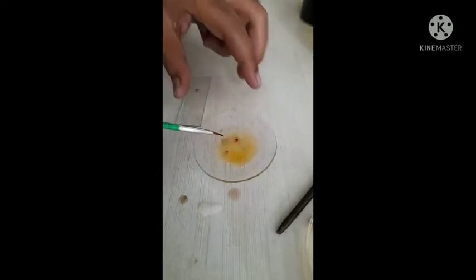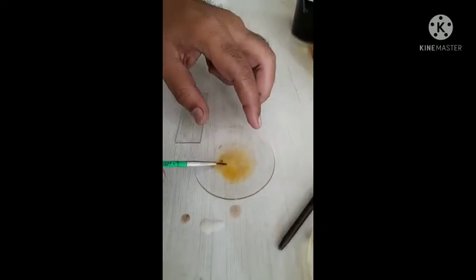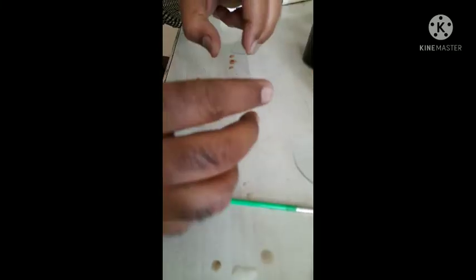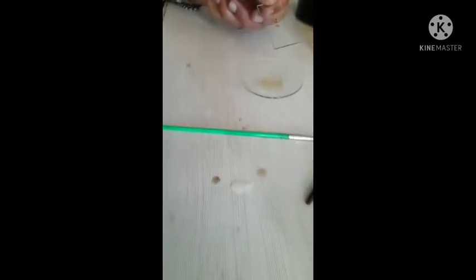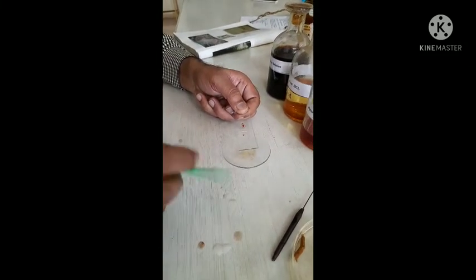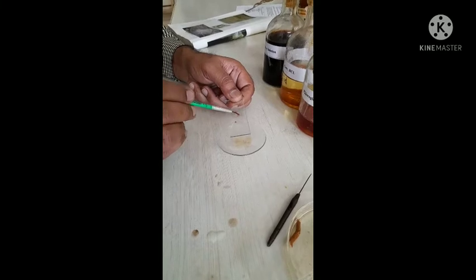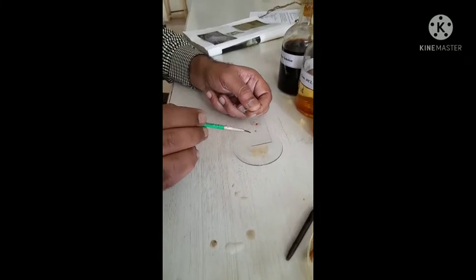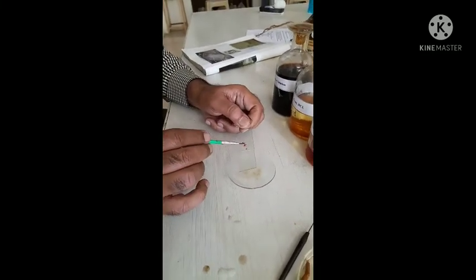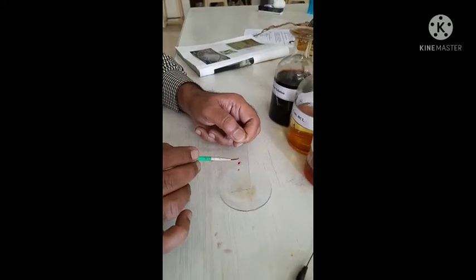Transfer the section onto a slide. In this way we are discarding the staining reagent. Again, clean the section by using cleaning reagent to remove the excessive colorant which is present on the section. We remove the excessive colorant with the help of cleaning reagent.